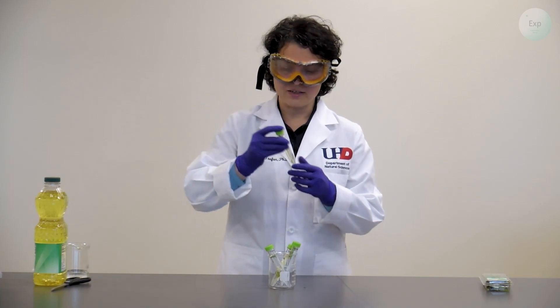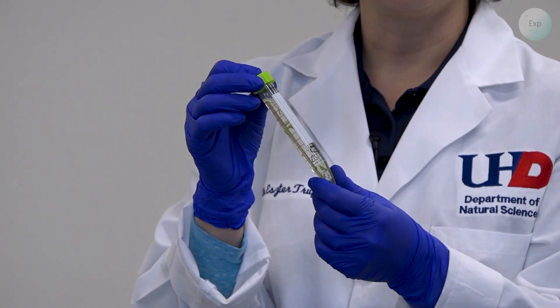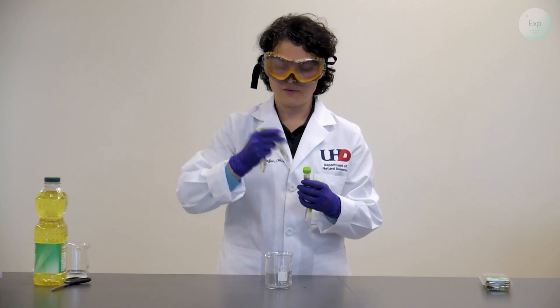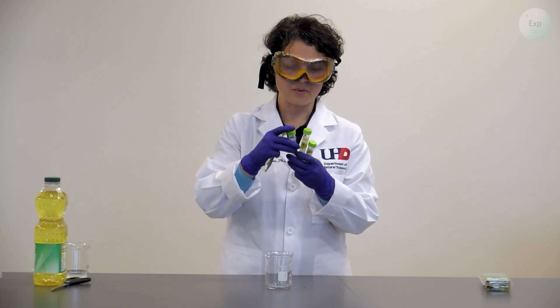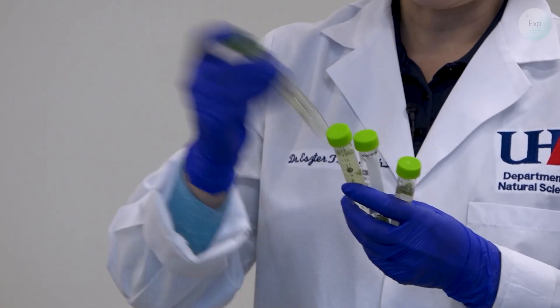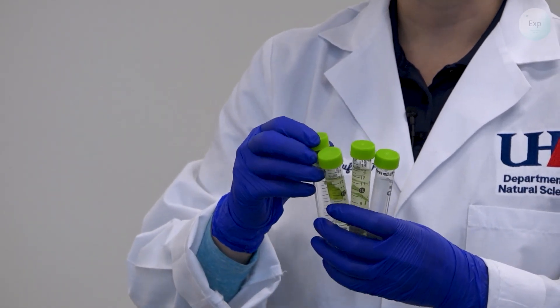For each of these vials, we already know what's inside just by looking at it, but if you're not sure you can always label them. You want to shake each vial really, really well a few times to make sure there is nice contact between the oil or water and the mint leaves. Then leave it out for at least 15 minutes before attempting the evaluation.